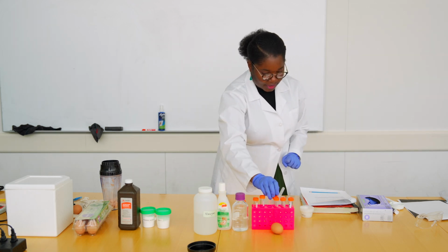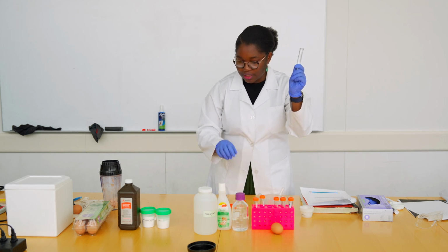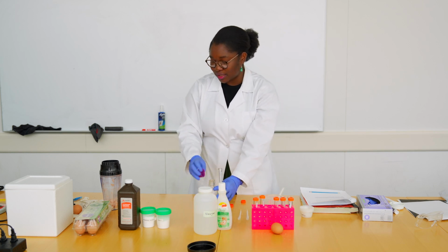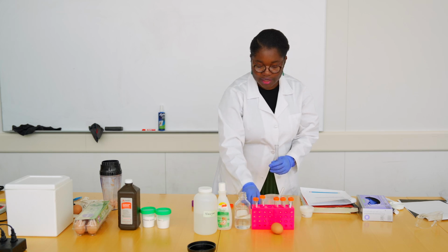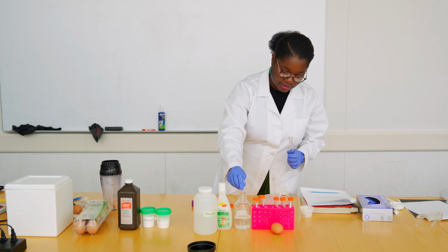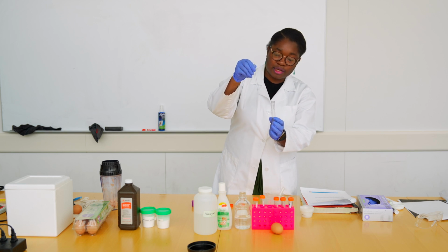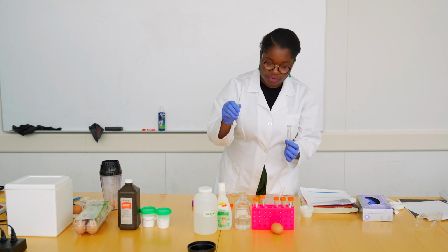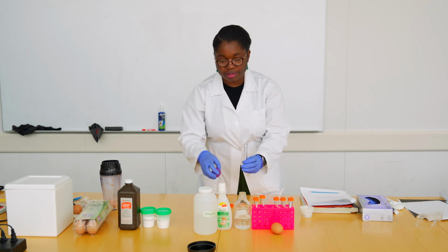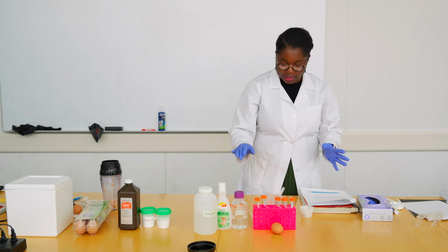And in our last tube, which is our control vinegar, we can add water instead of the enzyme, because this is another one of our controls. So here you change pipettes. You have another clean pipette. Get some water. 10 drops again, which is again about 1 ml. Never reintroduce the rest of the fluids in your source because you might contaminate it. So we have our base for all three ingredients.